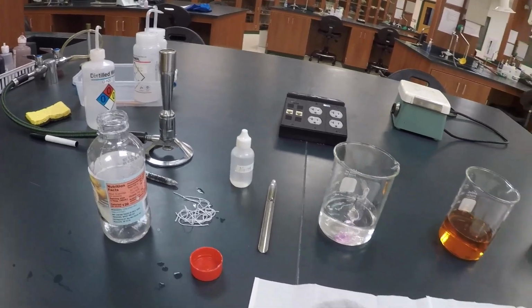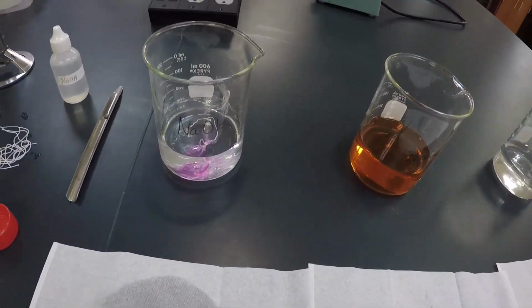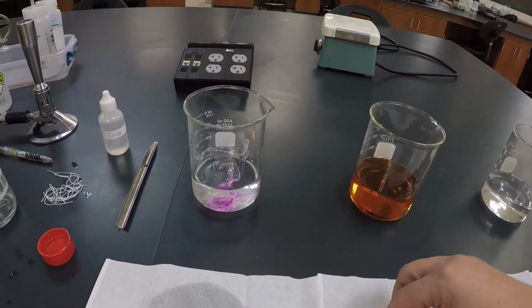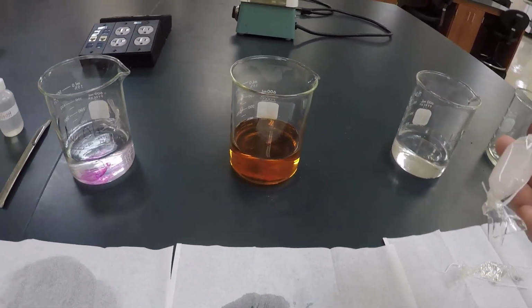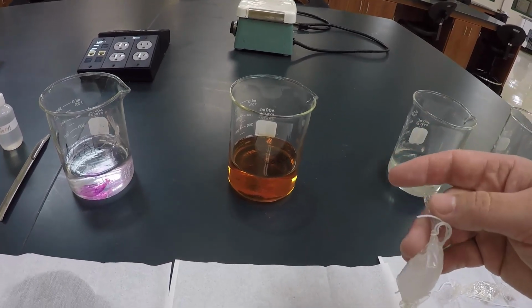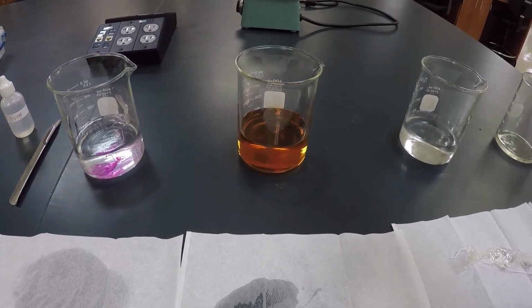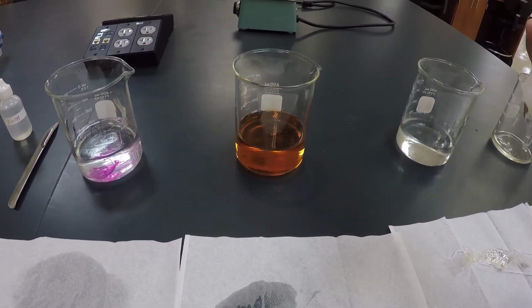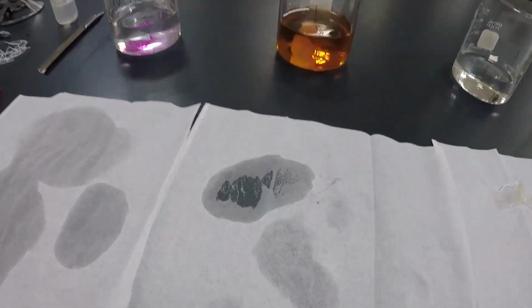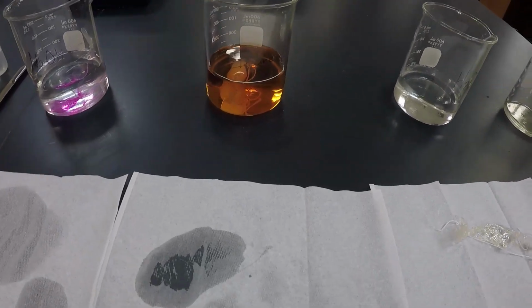So we're going to place that in, and you already start to see what I was hoping I wouldn't see, and that looks like the bag is leaking, but we'll see what happens. Okay? The next one is starch, which you just saw me fill, and iodine. Remember, iodine is an indicator of starch. When iodine comes in contact with starch, it turns black. And so we're going to toss that one in, and as long as I don't see black rolling out, we should be all right for now.